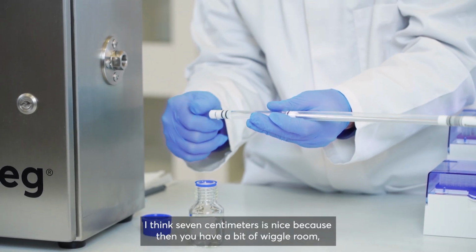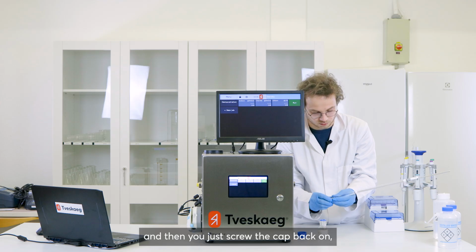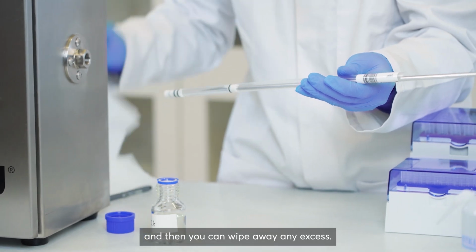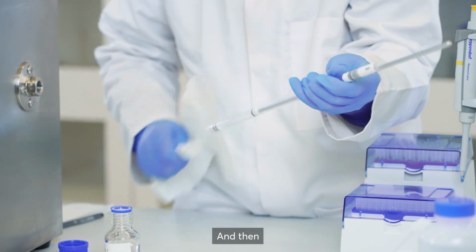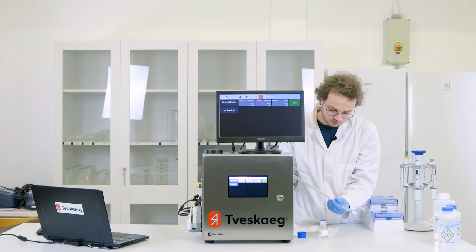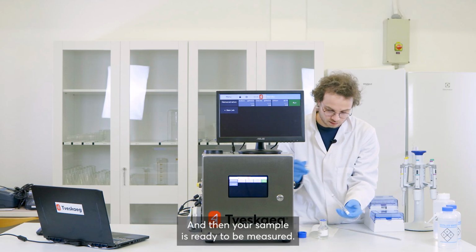I think 7 centimeters is nice because then you have a bit of wiggle room. Then you just screw the cap back on, wipe away any excess, unscrew your aluminium rod, and then your sample is ready to be measured.